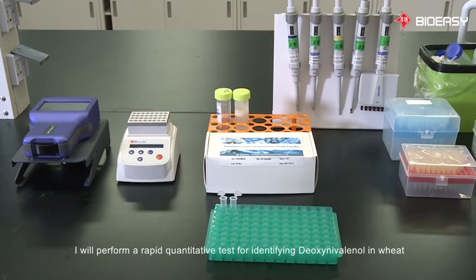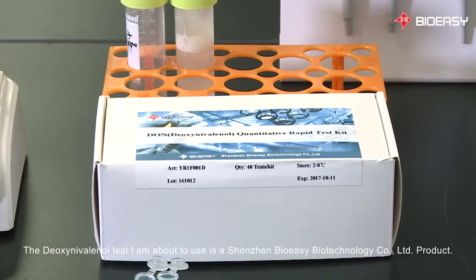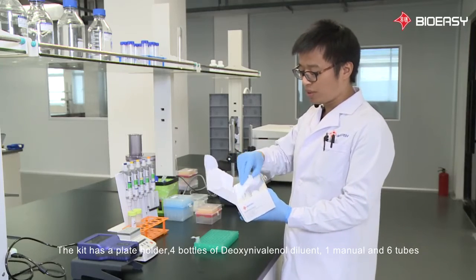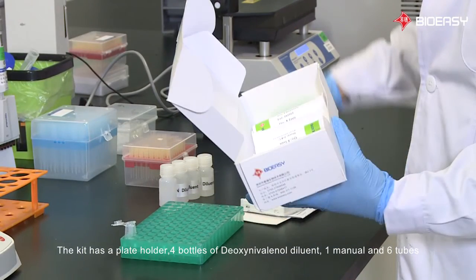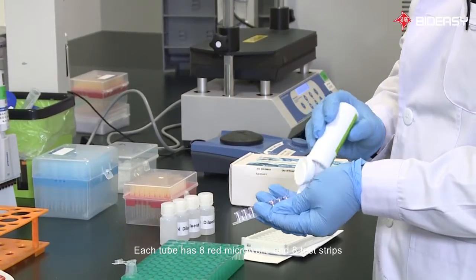I will perform a rapid quantitative test for identifying deoxynivalenol in wheat. The deoxynivalenol test I am about to use is a Shenzhen Bioeasy Biotechnology Co Limited product. The kit has a plate holder, 4 bottles of deoxynivalenol diluent, 1 manual, and 6 tubes. Each tube has 8 red microwells and 8 test strips.